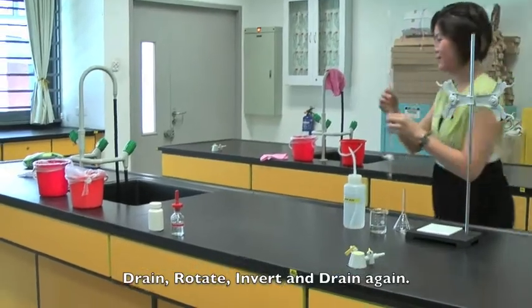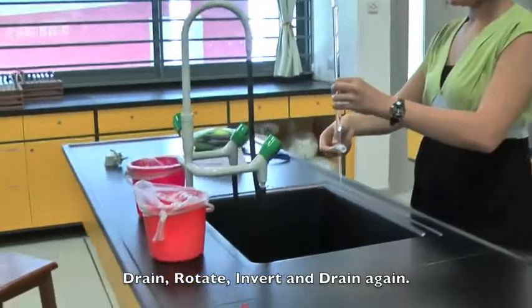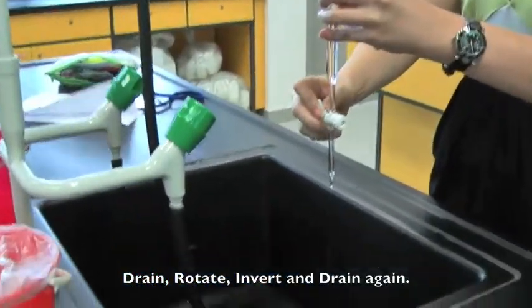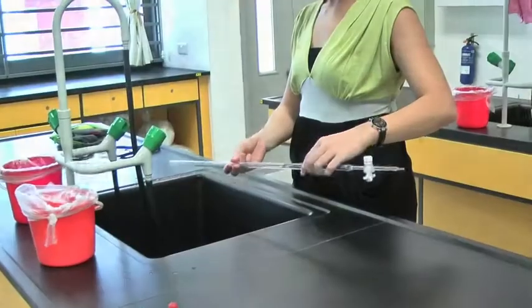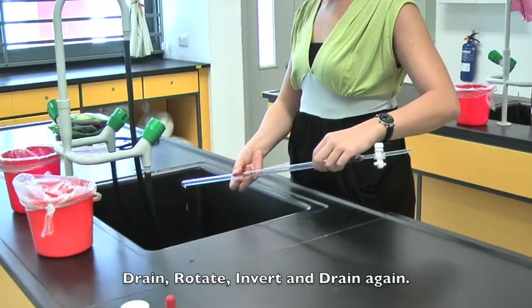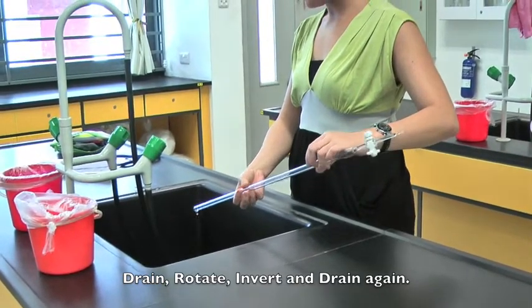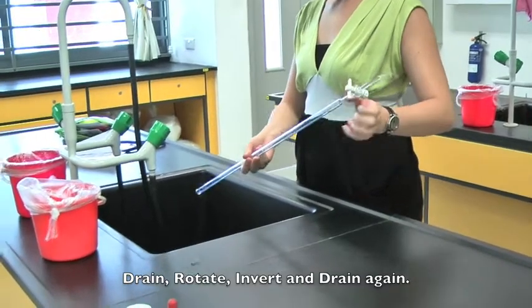To remove the tap water, firstly open the tap. Allow some water to drain out of the tap. Then tilt, rotate clockwise and anticlockwise. Invert and drain.